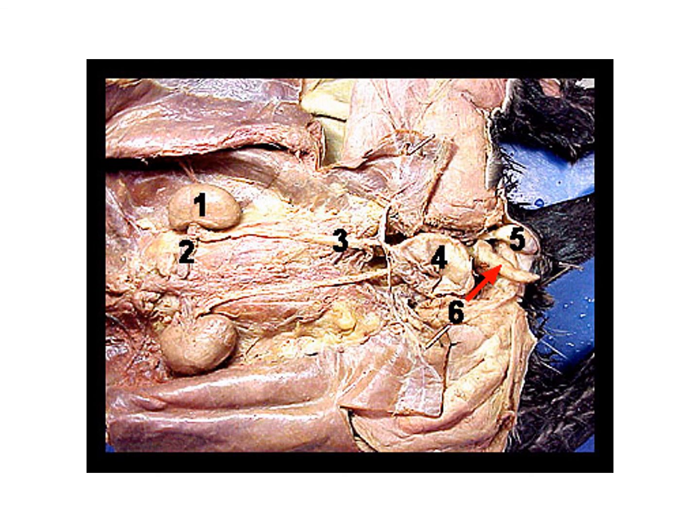So this is not histology, obviously, but it is a picture because I told a lot of you that were with me yesterday to look up pictures of the reproductive organs of the cat. This is definitely a male. For perspective, the structure labeled as number 4 is the cat's bladder.